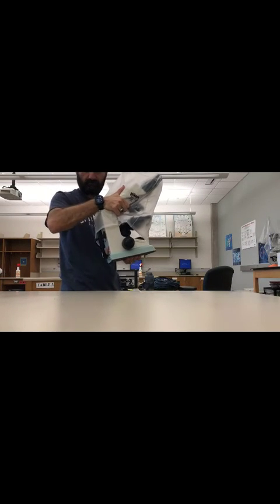Don't forget your dust cover. Grab the microscope. Remember, from the arm up here and the base below. That's the safe way to grab the microscope.